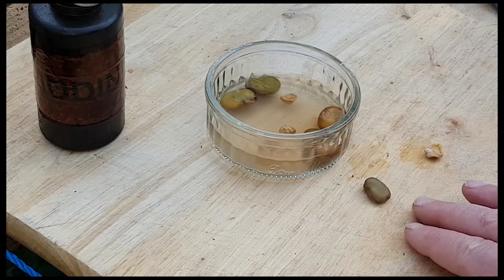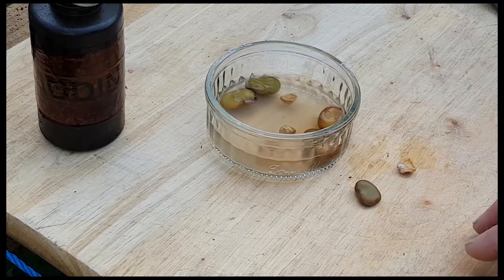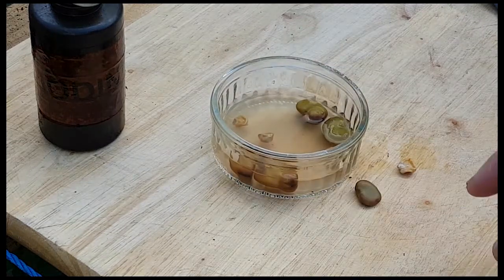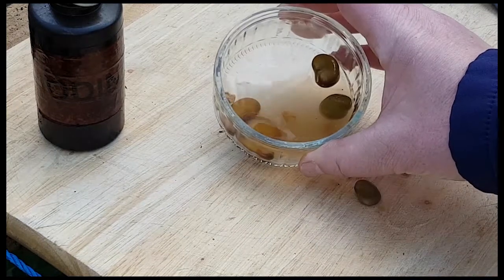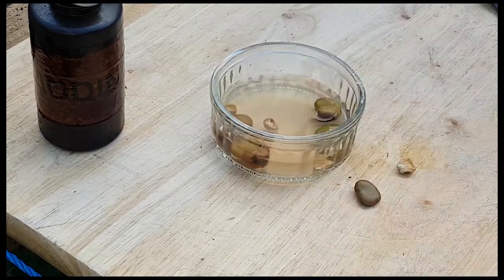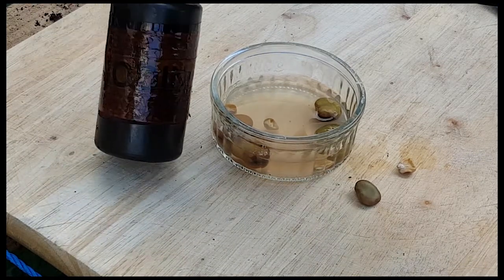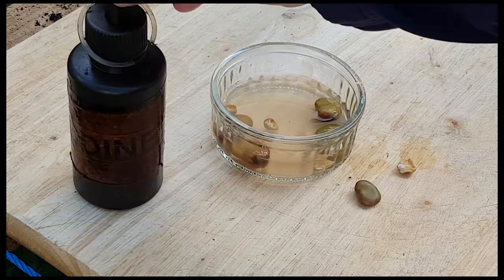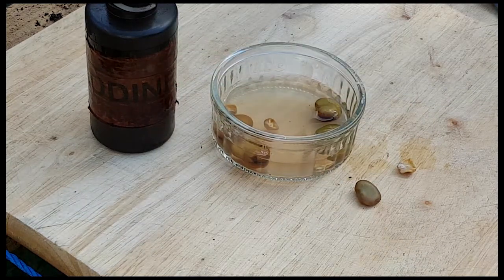The dry seeds are more difficult to use for this experiment, so what I've done is left some seeds in water for 48 hours so that they can imbibe water. Also for this video I will use some iodine stain, and it stains starch a black colour.